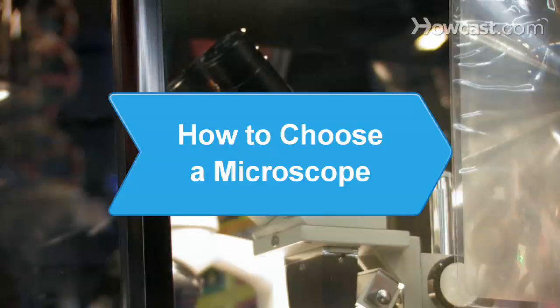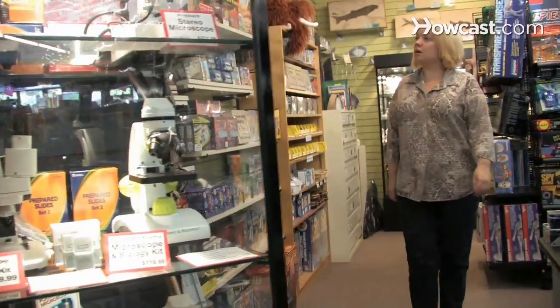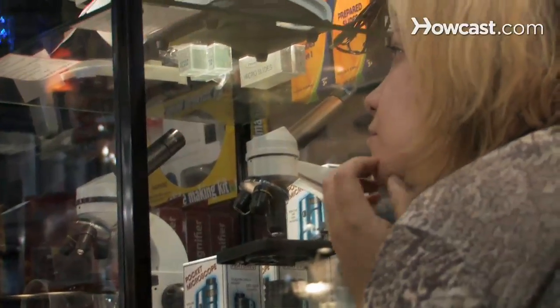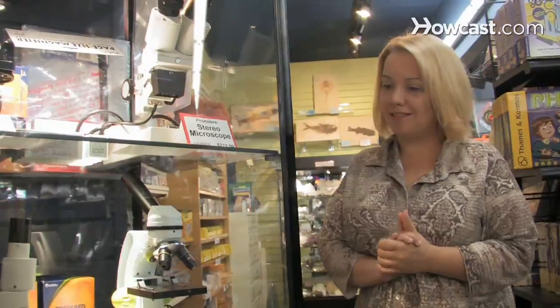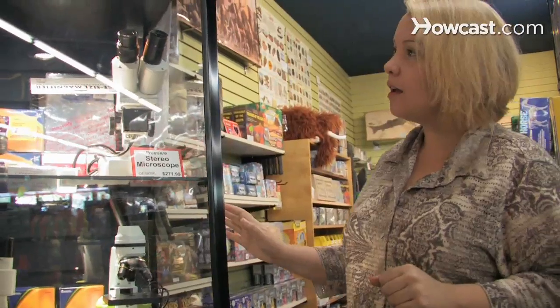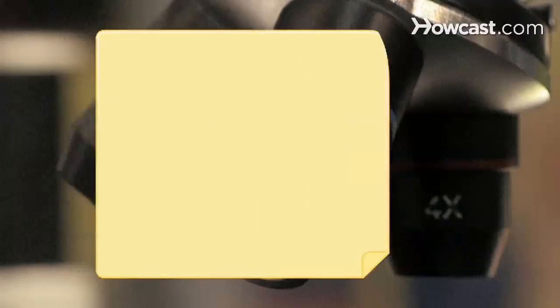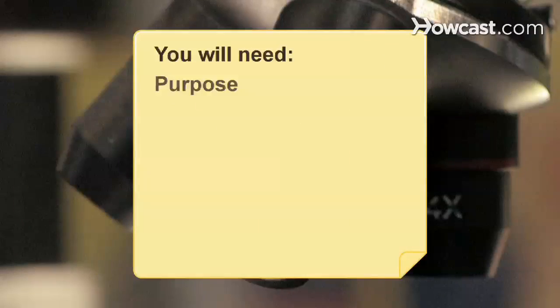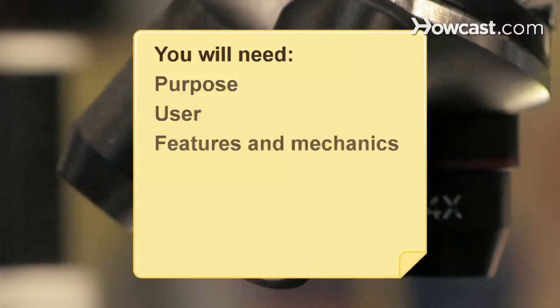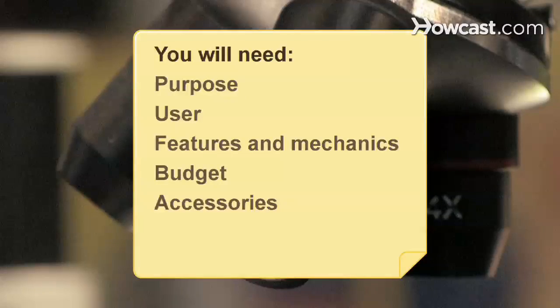How to Choose a Microscope. You may not have Superman's X-ray vision, but the power to see what escapes the naked eye is yours with a microscope selected to match your curiosity. You will need: purpose, user features and mechanics, budget, and accessories.